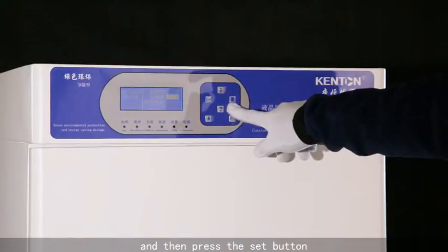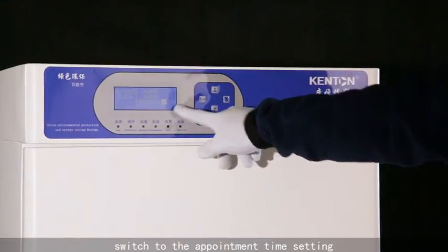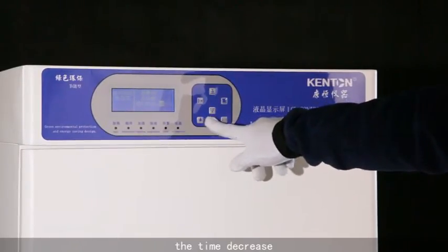Then press the set button. Switch to appointment time setting. The time increase, the time decrease.